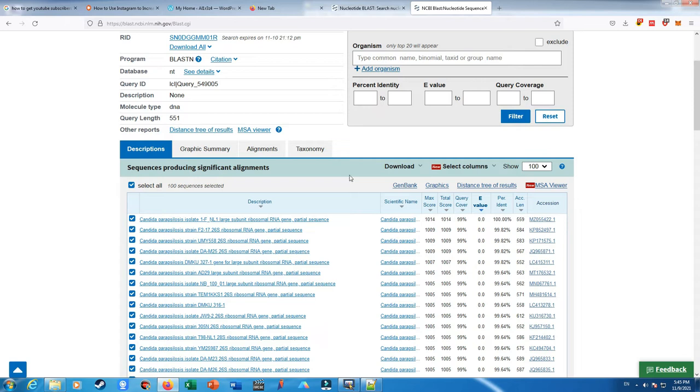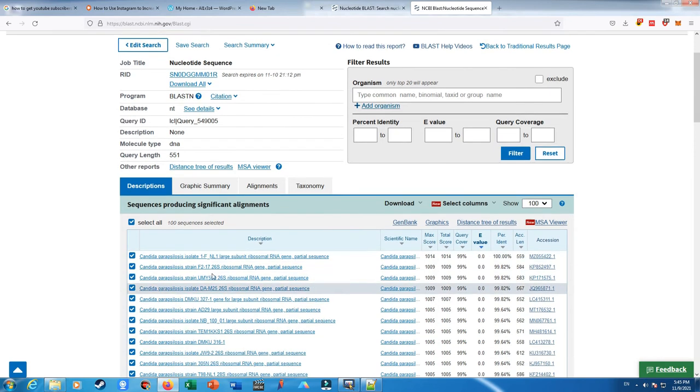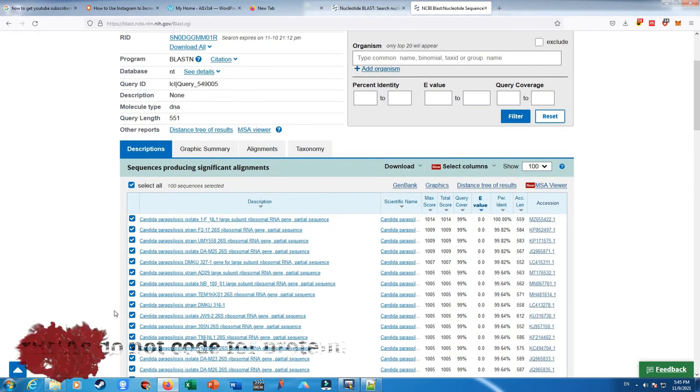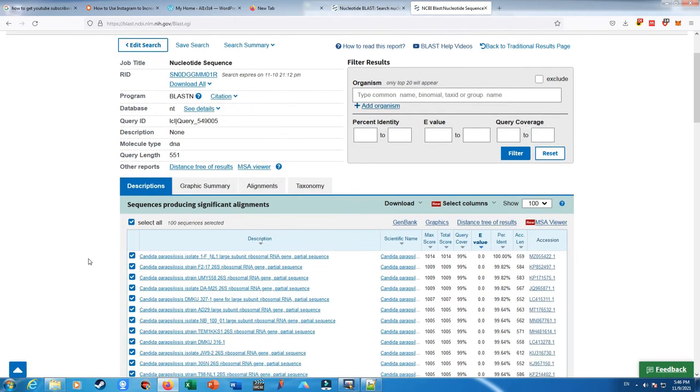So 99% of our 551 nucleotides is identical at 100% to what is in this accession number, which is the NL1 large subunit. So it is not a coding sequence. It is, as I can say, a ribosomal RNA, which is not coding, so we may not see any amino acid in here.